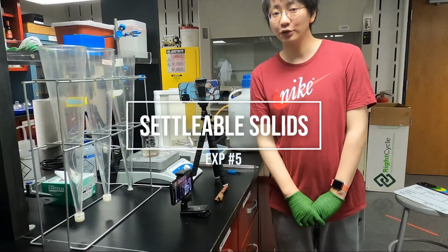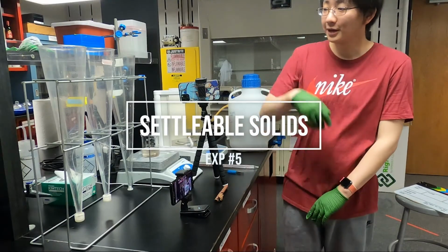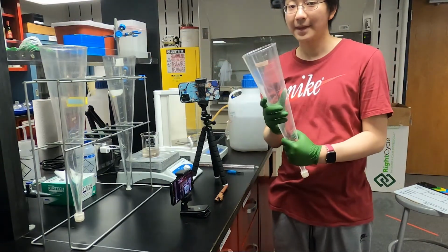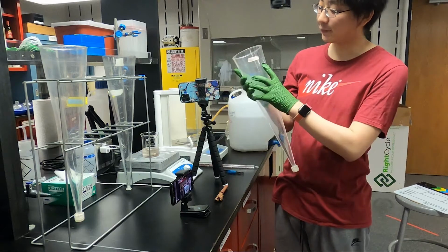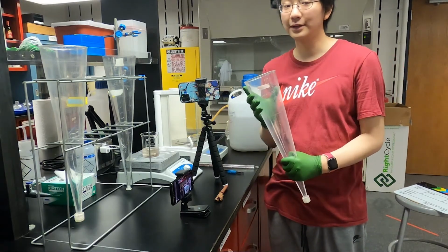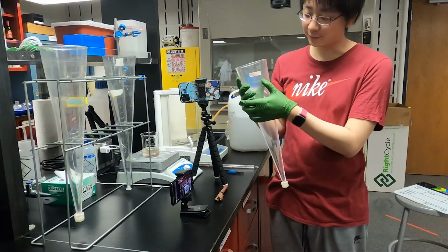So finally, we are going to measure settleable solids. For the settleable solids, we are going to use this cone. And in this cone, it has a 1 liter mark here. So we need to fill the column with the sample up to 1 liter.